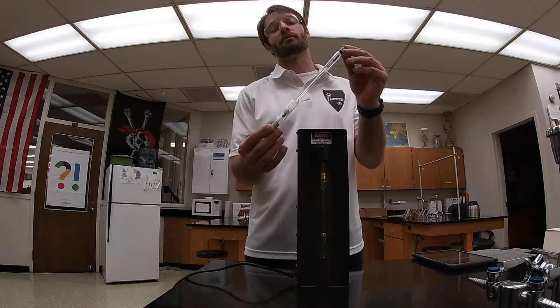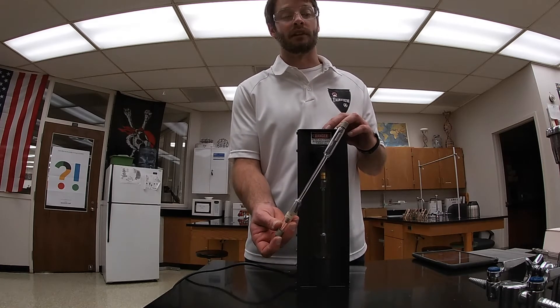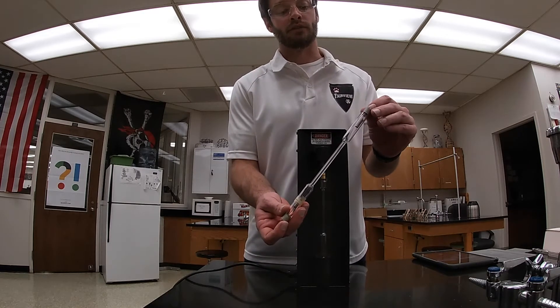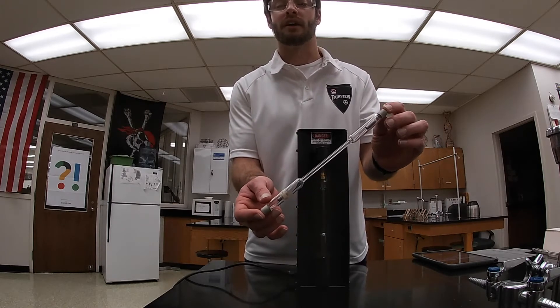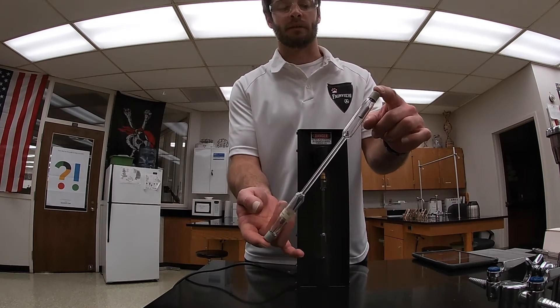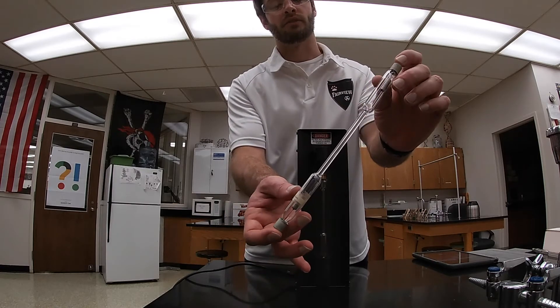In this lab, we're going to use gas tubes and hook them up to a lamp. When we turn on the electricity, the electrodes will allow the electrons in the gas to be excited, and it will enter the plasma state. I have a sealed gas tube with a specific type of gas. The first gas we will use is hydrogen.